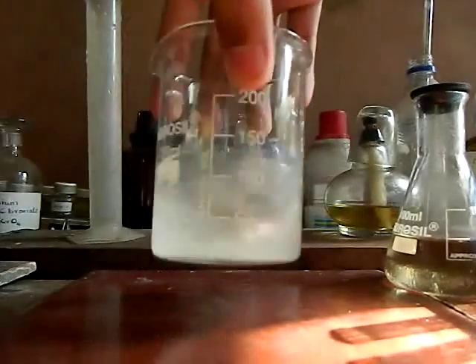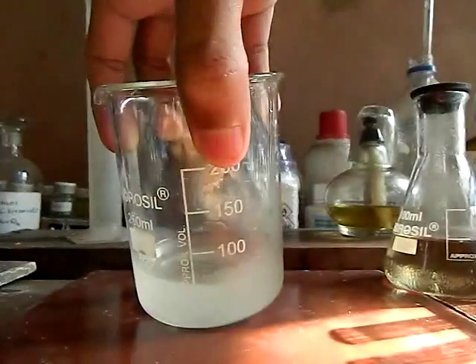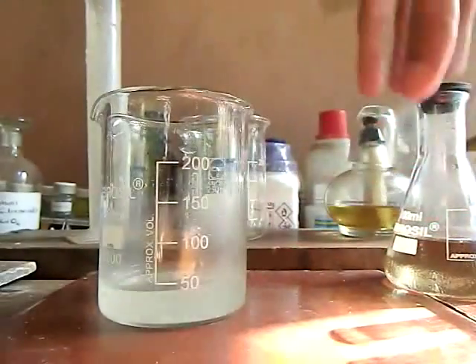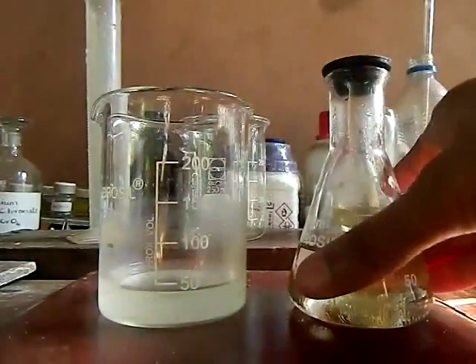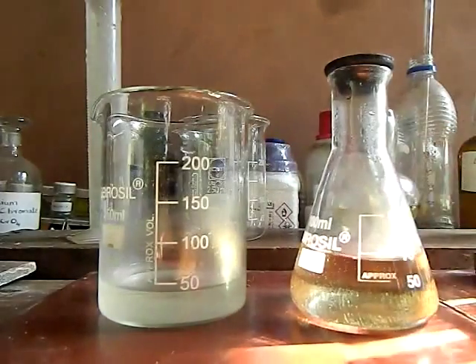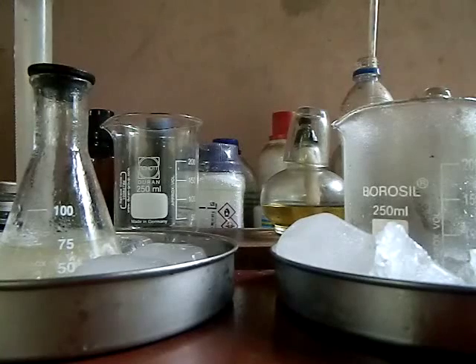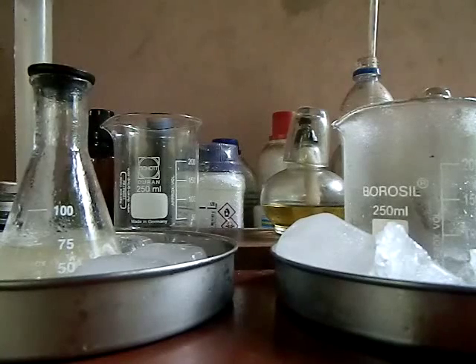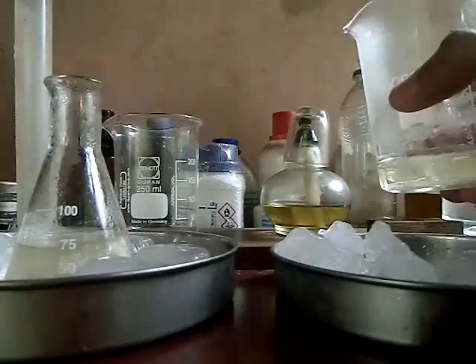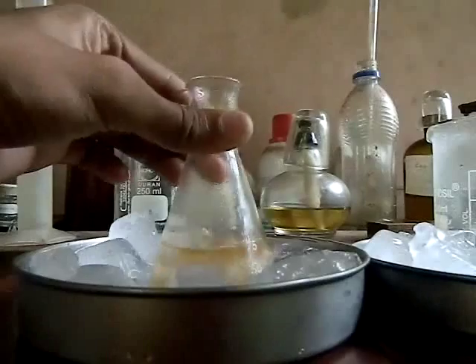Before we mix these two chemicals, the temperature of the reaction has to be lowered significantly. We cool both solutions to zero degrees Celsius by placing them in the refrigerator. Once cooled, we place them in an ice bath.